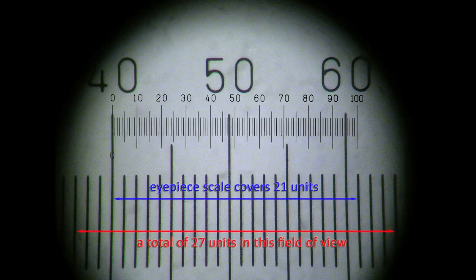You can see that by the red line I've drawn on this image, but this is important.